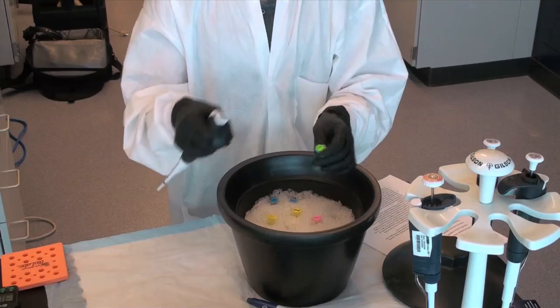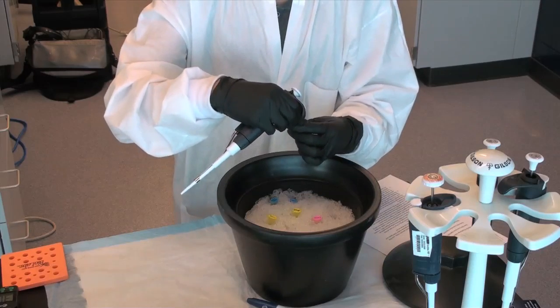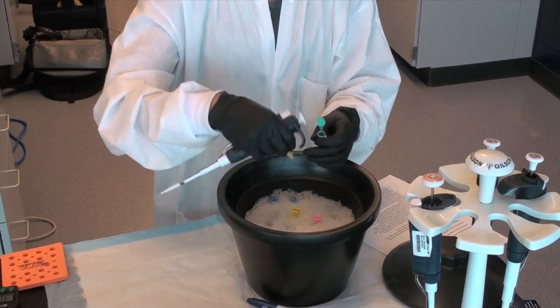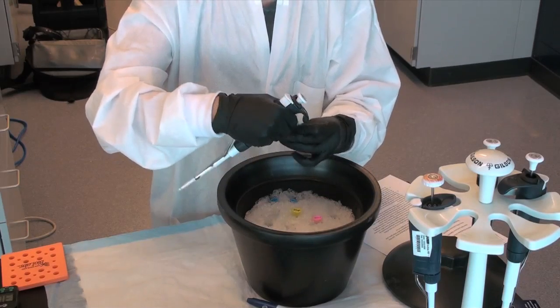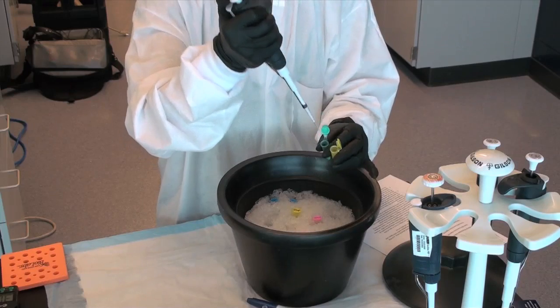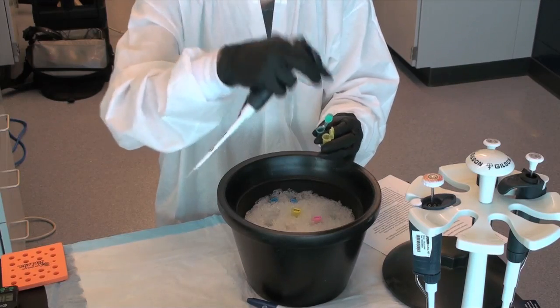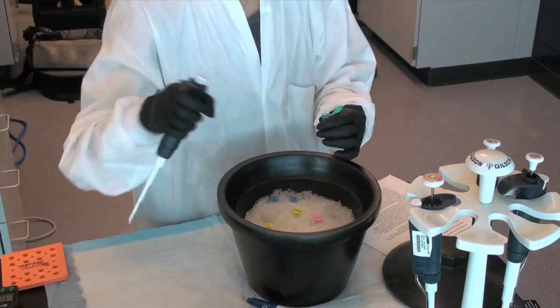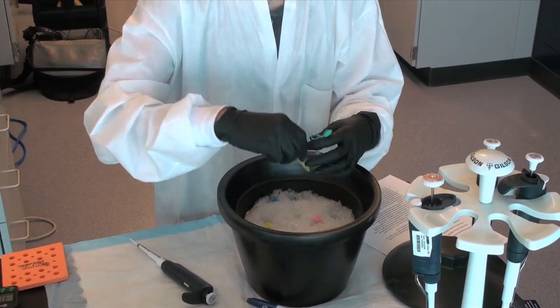Step 4: Aliquot the prepared amount of vector for the desired ligation ratio into an Eppendorf tube and also prepare Eppendorf tubes for the two control reactions. For example, we will be using 200 nanograms of DNA. To figure out the volume, divide 200 by the concentration of the plasmid to obtain the volume in microliters.